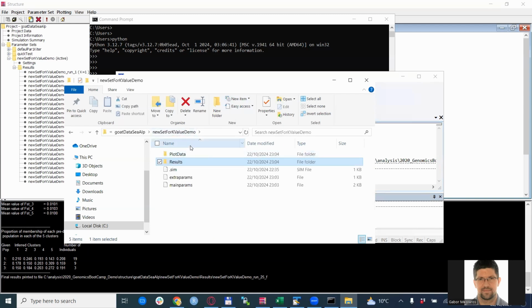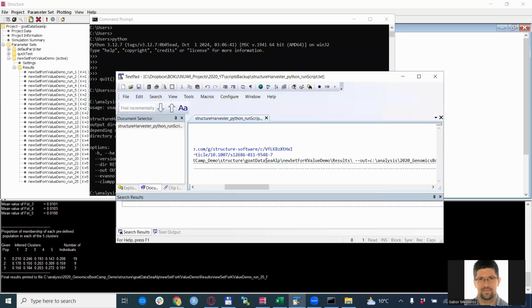And basically you need to put the path to this results directory. So this is exactly what I did here. So this is the goat data, the new set for k-value demo results. So this is the results folder that we would use. Then further up dash out equals, and then I just put the structure harvester results also into the same directory, like for the new set for k-value demo, but I created a new folder harvest results. But of course, you can use anything that you would like.